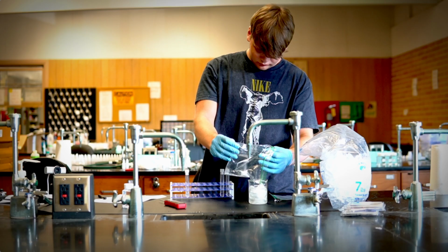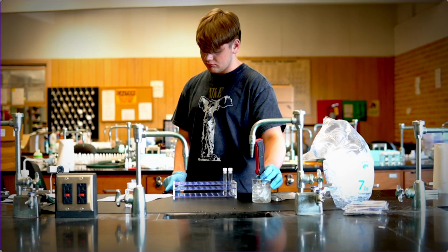This is what you're writing down. However, sometimes it might freeze. We want the water inside the little tube to eventually freeze. It might not freeze in the first one, but at the bottom of the table, I'm asking you, did the water freeze? If yes, give me the temperature and time at which it froze. So you've got to keep an eye on it to see whether it freezes. The idea is that it's going to look different.